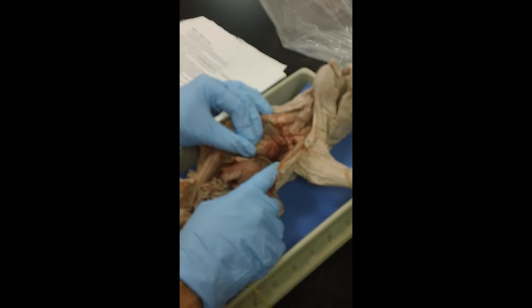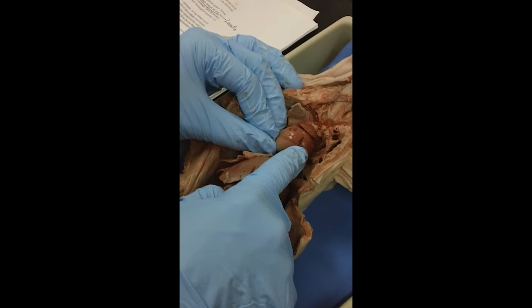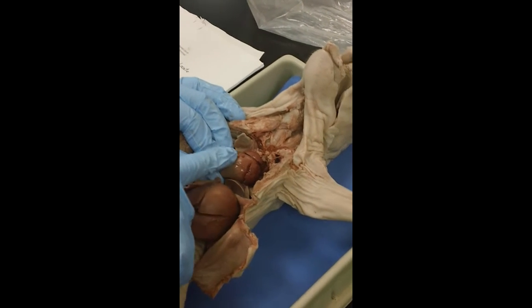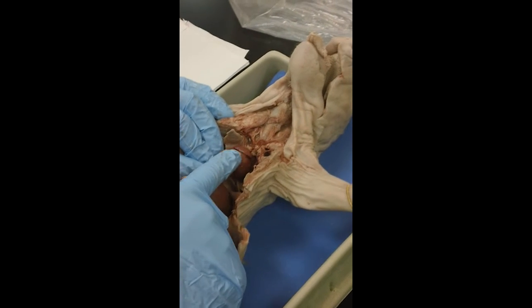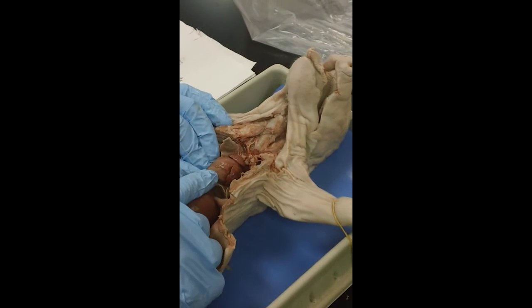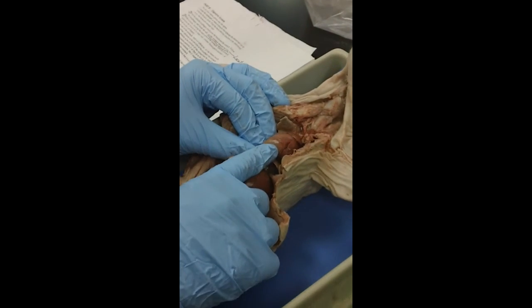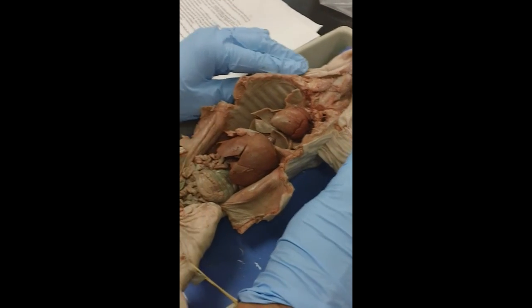And then finally, this is the heart. A mammalian heart, as I mentioned, has 4 chambers. The 2 top chambers are the atria, which receive blood into the heart, and the 2 bottom chambers are ventricles that pump blood out of the heart. Notice they are much thicker walled than the atria. The heart also has a set of vessels that sit on top of it, and they nourish the heart itself with a rich supply of oxygen at all times, because it can't wait for the blood to be oxygenated. It's got to have oxygen and nutrients at all times. So it has its own circulatory system. And I guess that does it for the fetal pig.